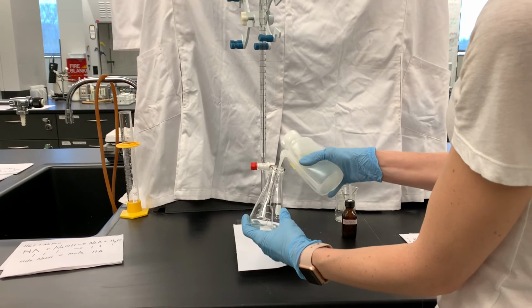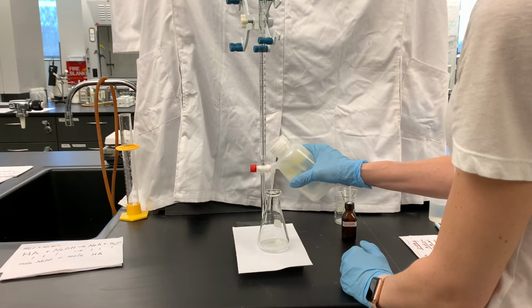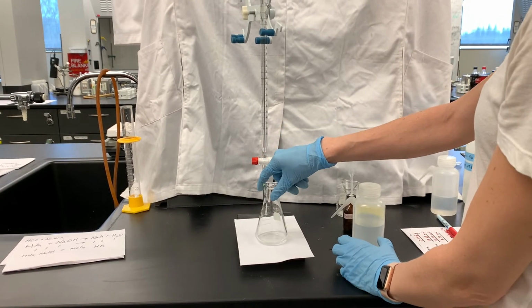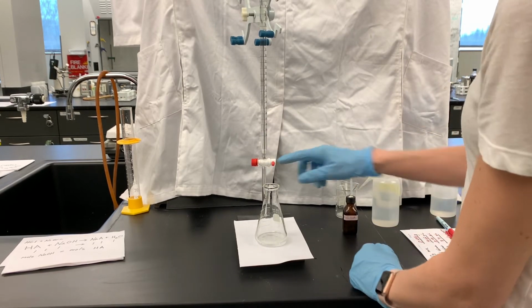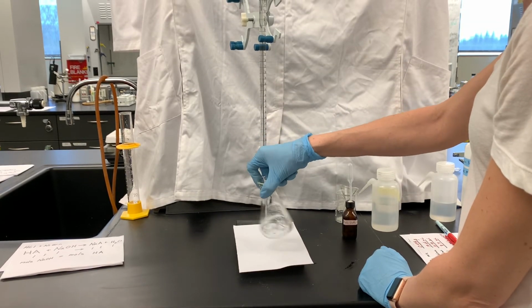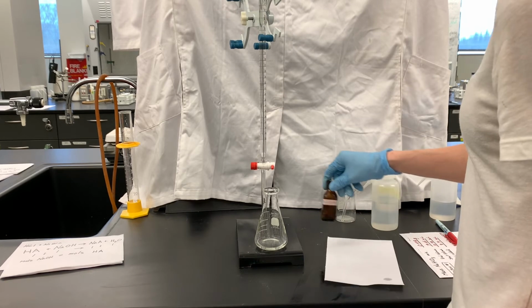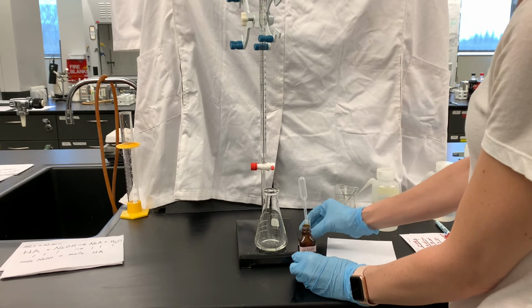All right, we're ready to titrate the carboxylic acid. I'm going to put a little bit of water in here to dissolve the carboxylic acid. The instructions say to use a specific amount of water, but it really doesn't matter how much water you add. You just want to have enough in there to get the reaction started. It also doesn't matter if it's completely dissolved or not at the beginning of this titration, because it will finish dissolving once we start titrating. And it looks like mine is mostly dissolved. Pretty much completely dissolved.